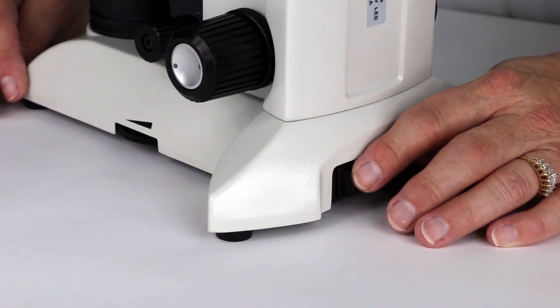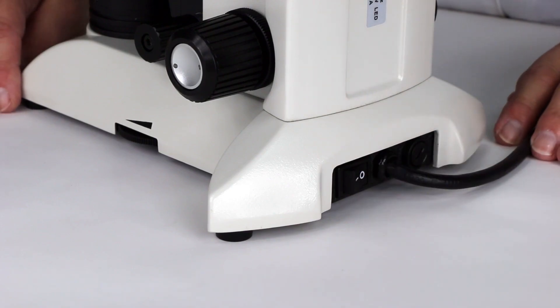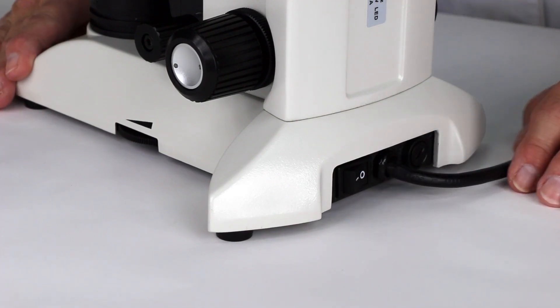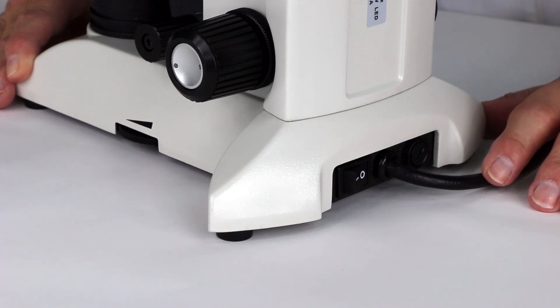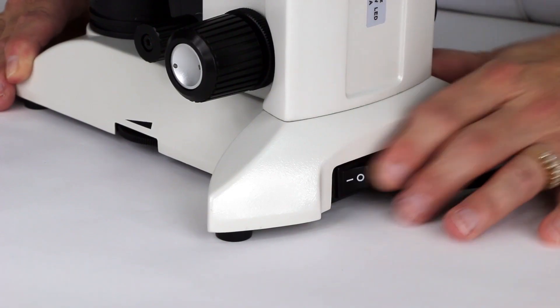Sometimes the illuminator appears not to work. One of the first things you check is if the microscope is actually plugged in, and that has happened to me before. Then also, after it's plugged in, make sure that you have it turned on.